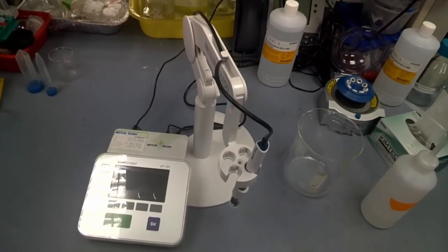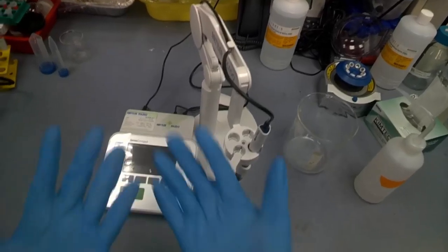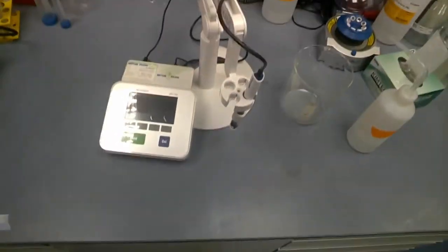Before you do anything, make sure that your PPE is on. Make sure you have your gloves, your safety goggles, lab coat, cover shoes, long pants, and socks that cover your ankles.